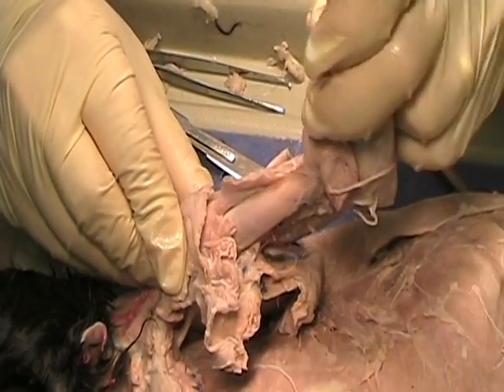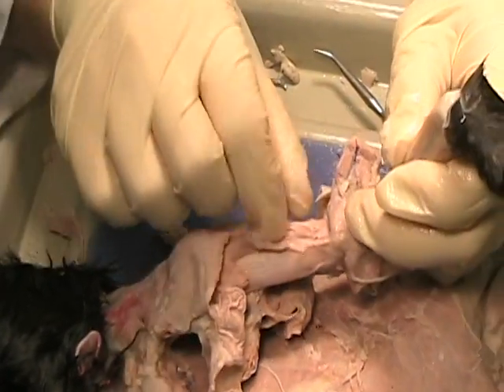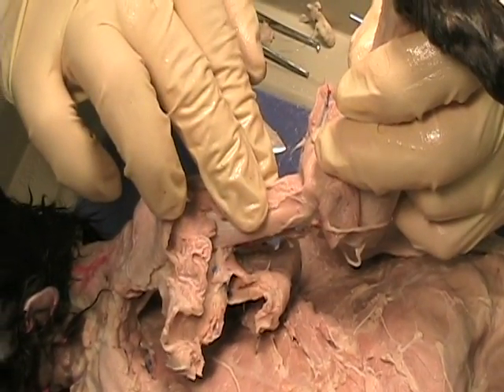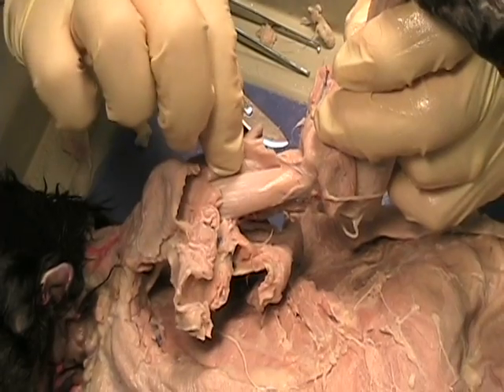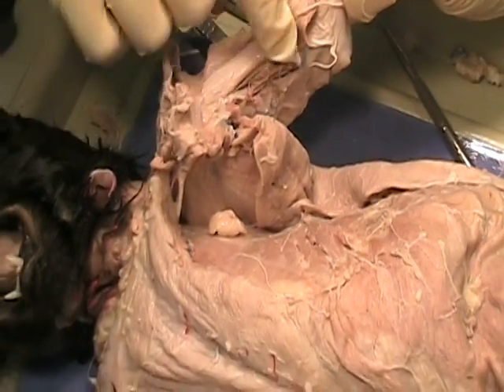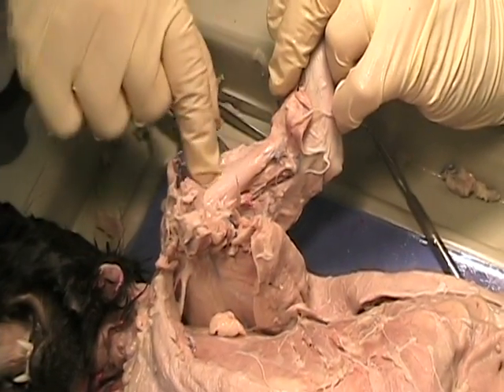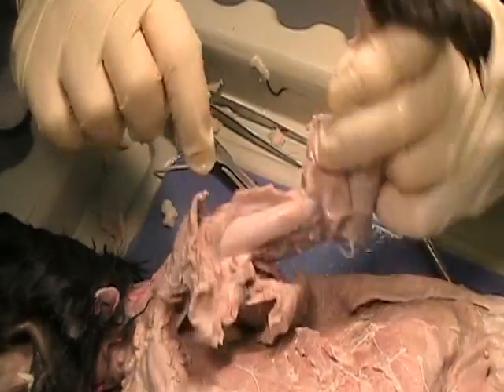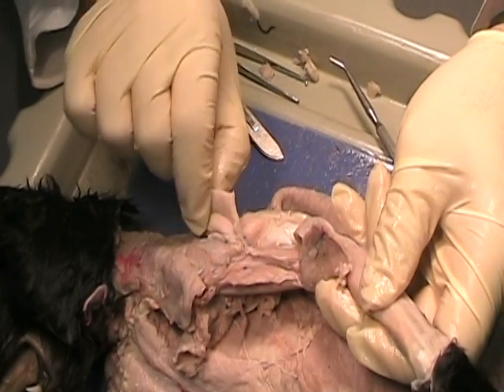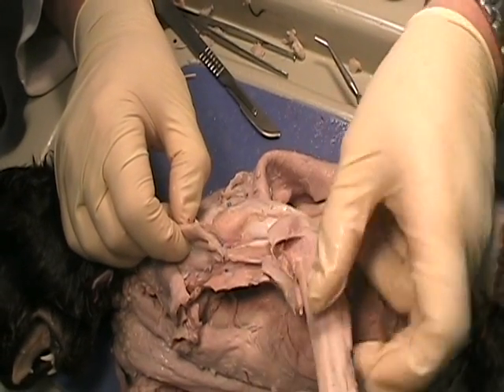So both these muscles are side by side. In the human body they're actually located slightly differently — the brachialis is underneath the biceps. You can see it's a nice, straight, strong thing. The biceps is larger than the brachialis, which is very small. The biceps and brachialis would both be larger in humans than they are in cats.